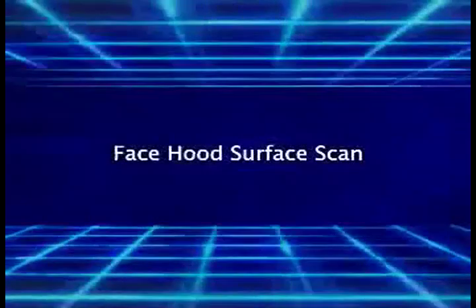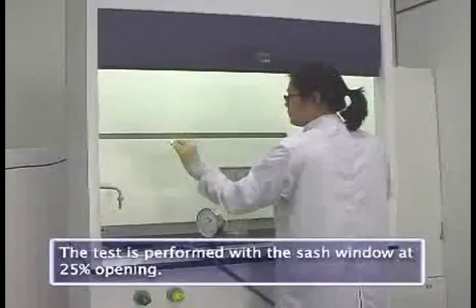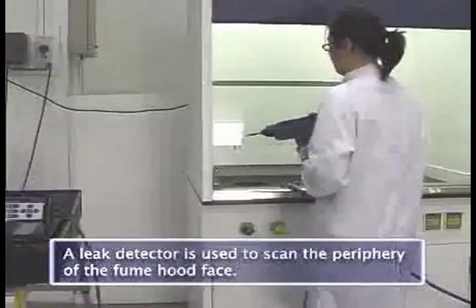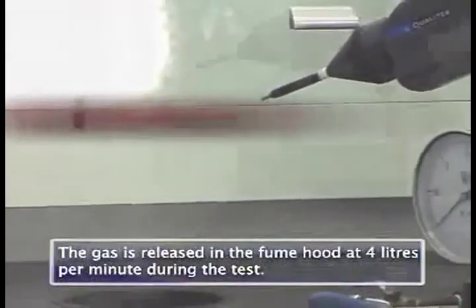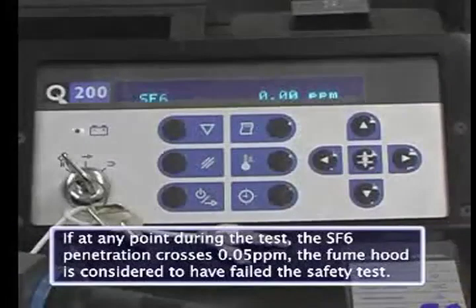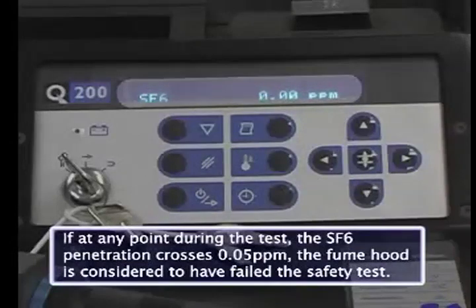The face hood surface scan test is conducted with the sash window open to 25%. A leak detector is used to test the periphery of the fume hood face as gas is released within the hood at a rate of four liters per minute. If the penetration of SF6 tracer gas exceeds 0.05 ppm, the fume hood fails the test.